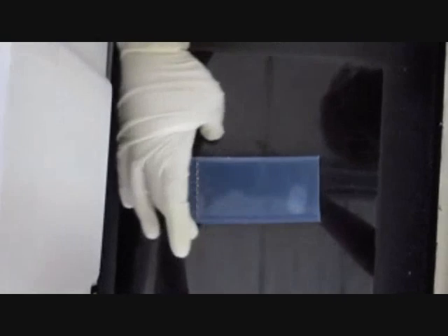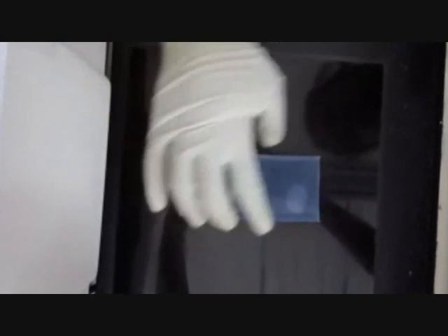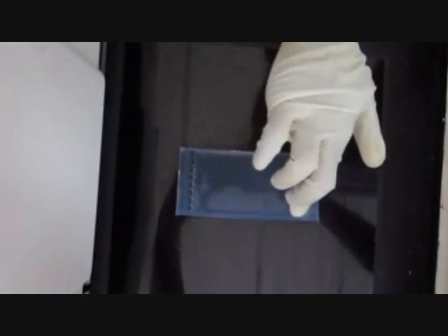Once the gel is placed on the stage, any air bubble that might be present is slowly removed by gentle pressure using the hand.